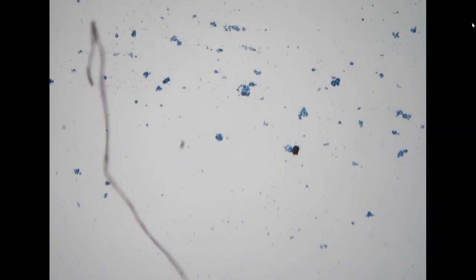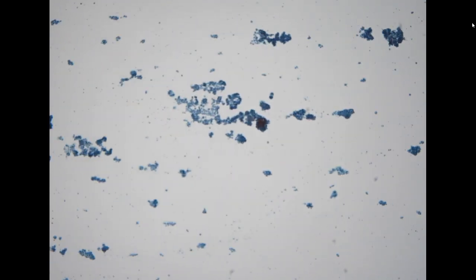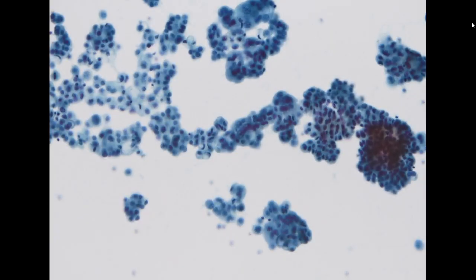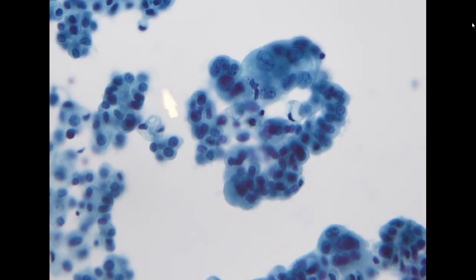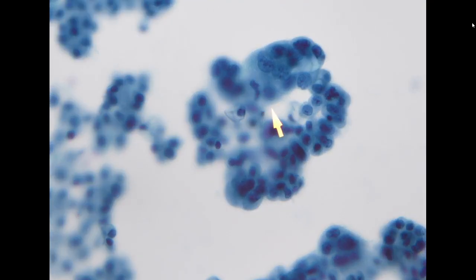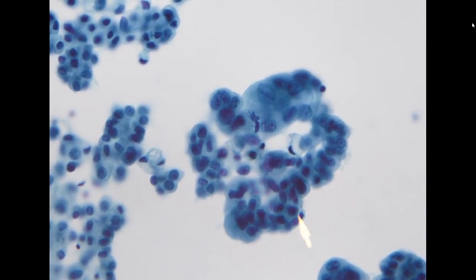The next specimen is a pleural effusion. The patient had a history of lung adenocarcinoma. On low power, you can see hypercellularity, and a lot of cell clusters in small nests. On high power, you can appreciate the three-dimensional architecture, where you need to focus up and down to see the focus of each plane. The cells demonstrate vesicular chromatin in large nuclei with abundant subvacuolated cytoplasm, arranged in a glandular pattern.